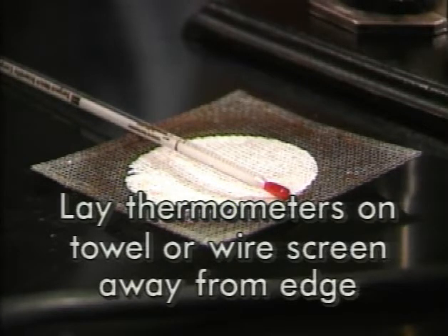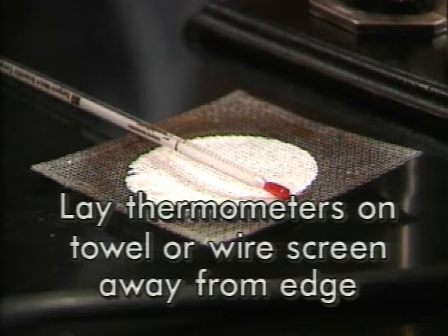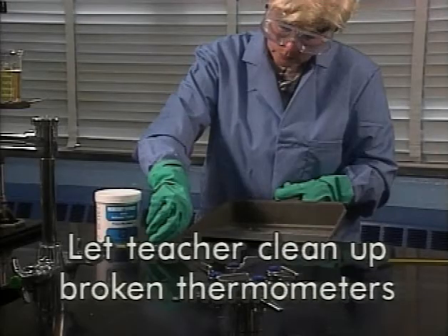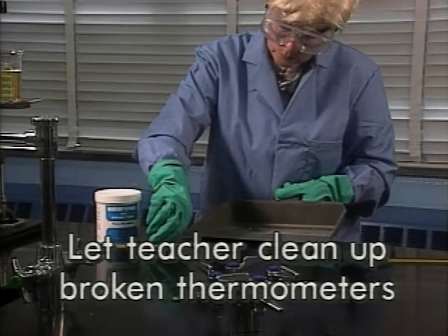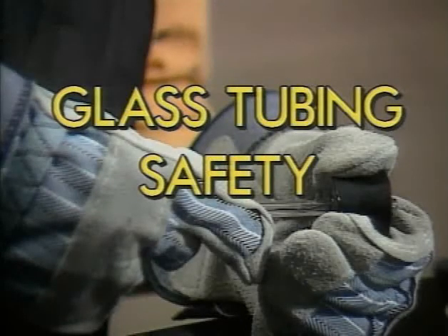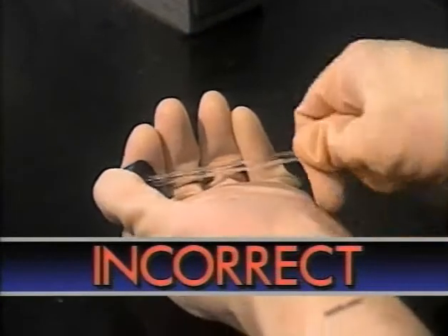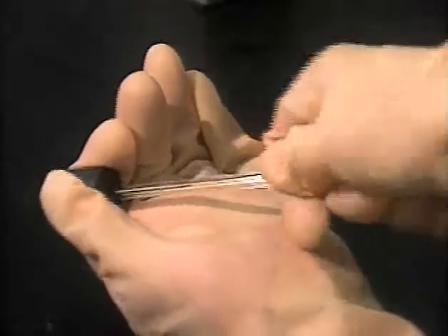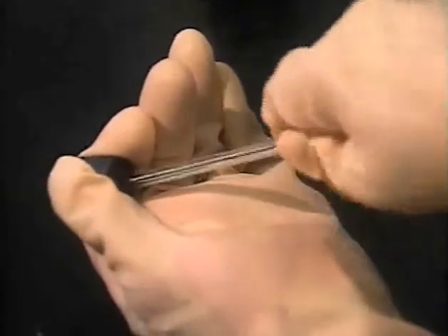Thermometer summary: don't shake thermometers; use thermometers only in the temperature range they're suited for; lay thermometers on a towel or wire screen to cool, away from the edge of the bench; let your teacher clean up broken thermometers. The most common lab injuries are cuts from broken glass, especially glass tubing.